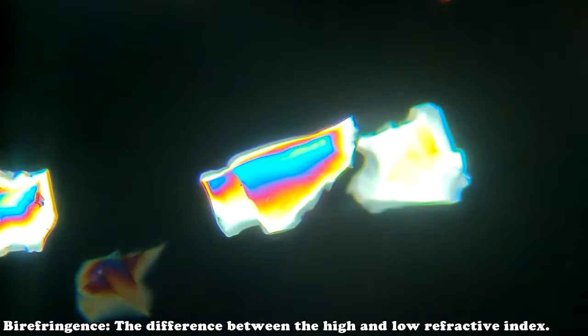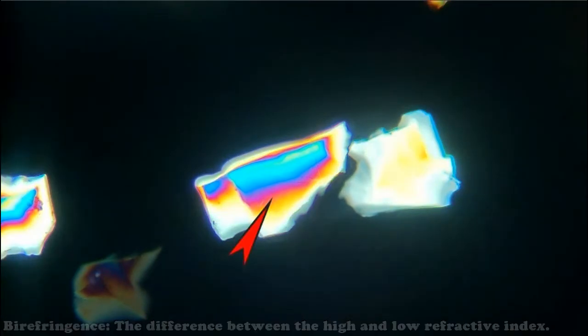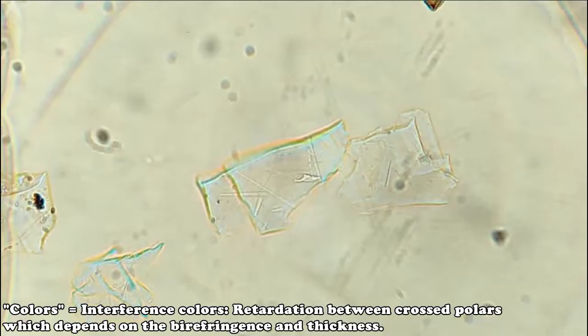Quartz often exhibits a conchoidal fracture, which can appear as either a concave or a convex feature. Even though quartz has a very low birefringence, less than 0.01, you can easily see the first into the second order colors as a smooth transition because of the wedge shape of the fragments.